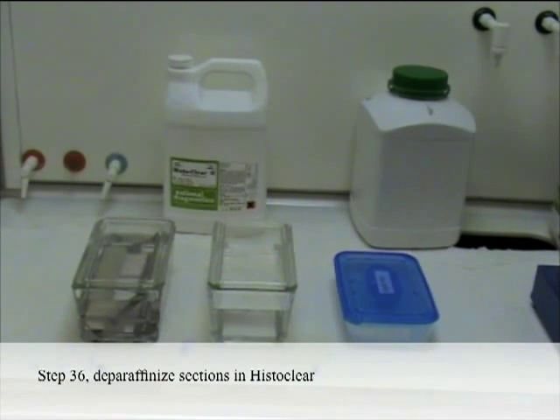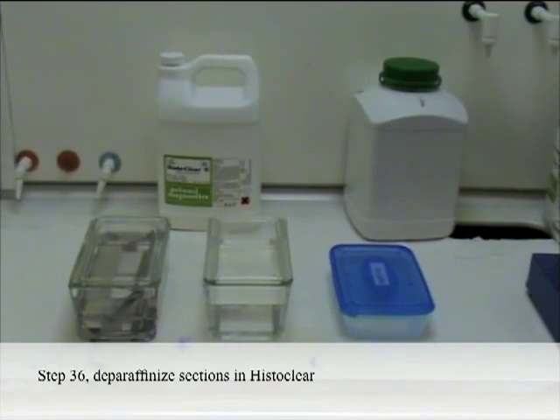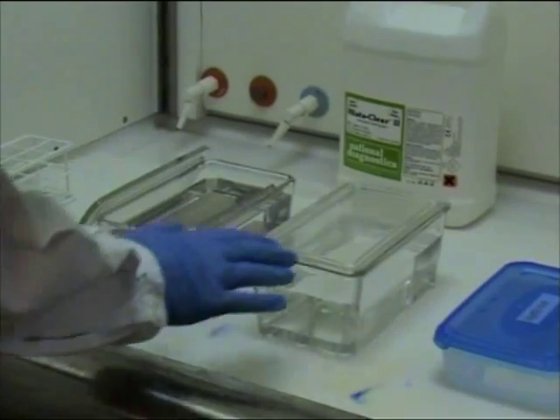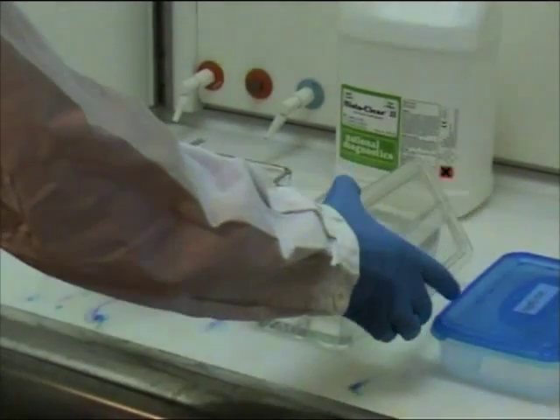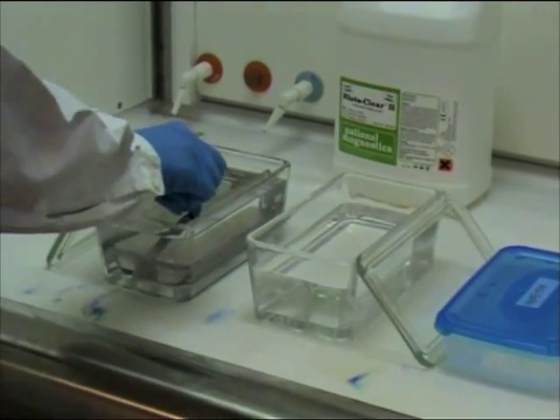Step 36: Deparaffinize sections in histoclear. The slides are evenly spaced and placed in a rack to facilitate the movement between different containers.